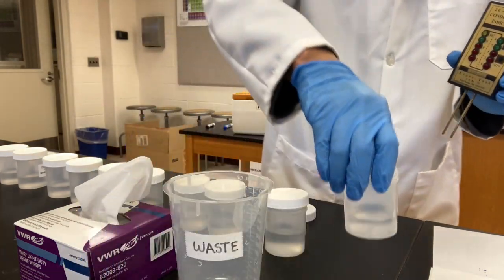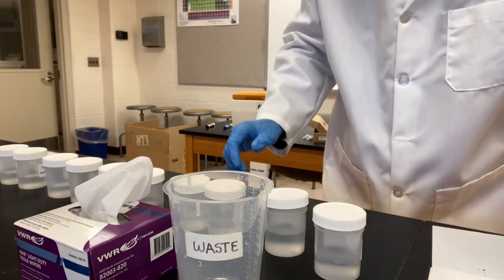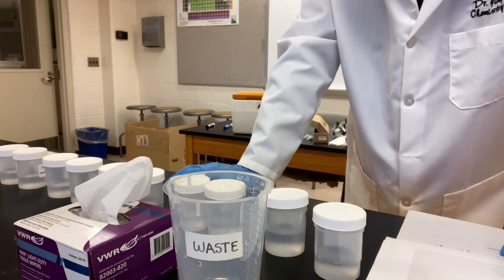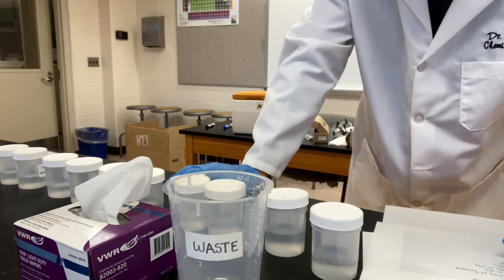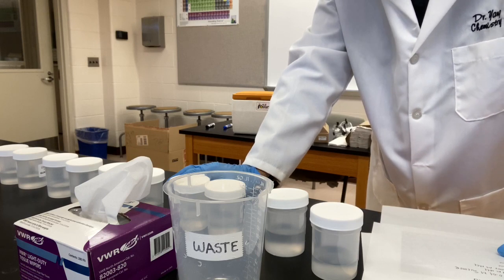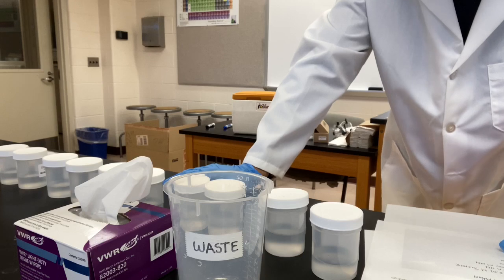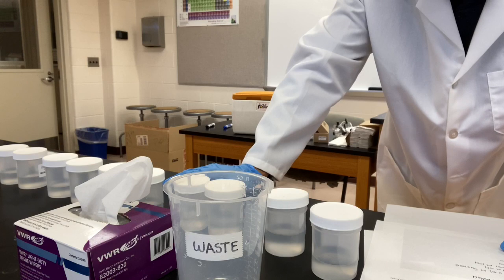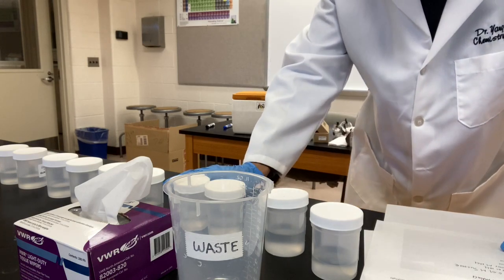Okay, before we perform this experiment, we have 10 solutions, but these 10 solutions are different from the ones in the lab manual. So let's take a record of the solutions we're going to use. Go to your report sheet, find the solution, and write down the solution we're going to use. It may be different from the solutions on your report sheet. We do have distilled water, tap water. We do not use 1 M sodium chloride.